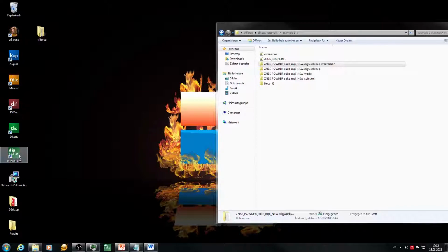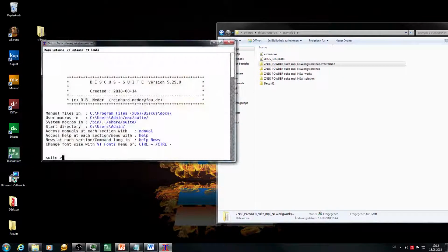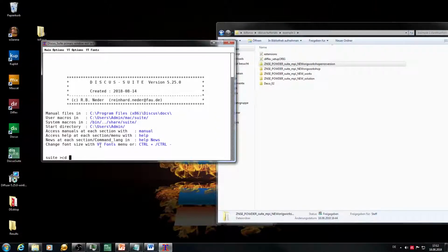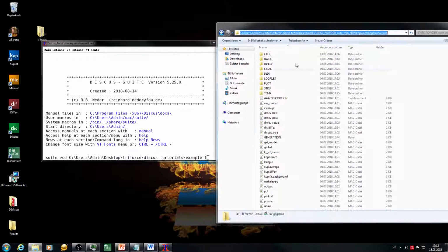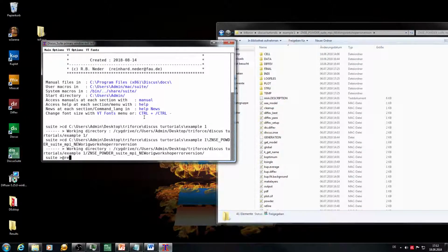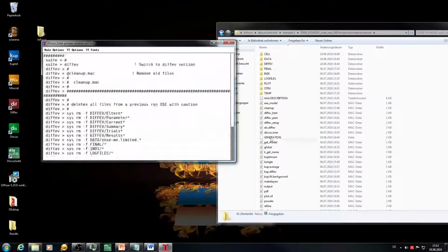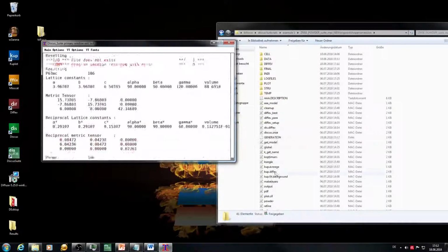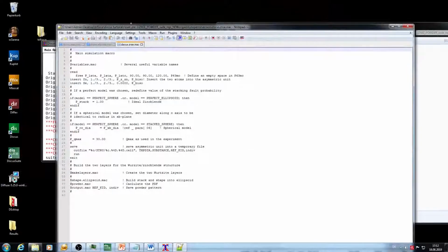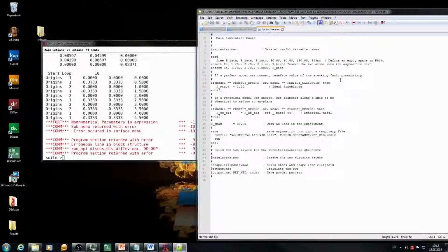So with that, we'll just jump right into the macro. We're working today with Discus version 5.25 because it already has the new look. Then we are jumping into the folder of the error, which is this one. So this is the workshop version of the macro with the error in it, and we just start the refinement. The version we are looking at now is this. This is the main part of the macro. Again, it's creating some spheres here.